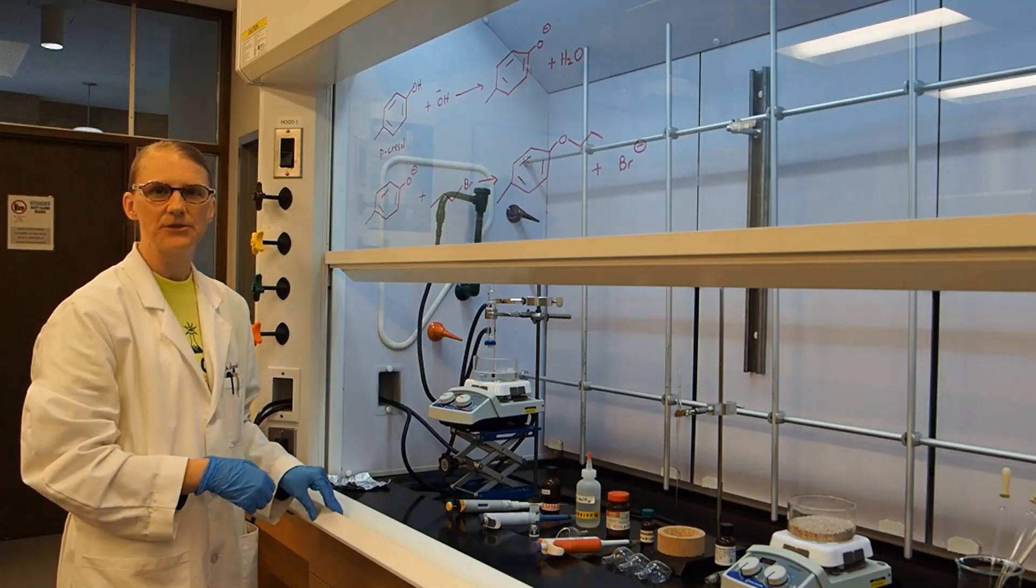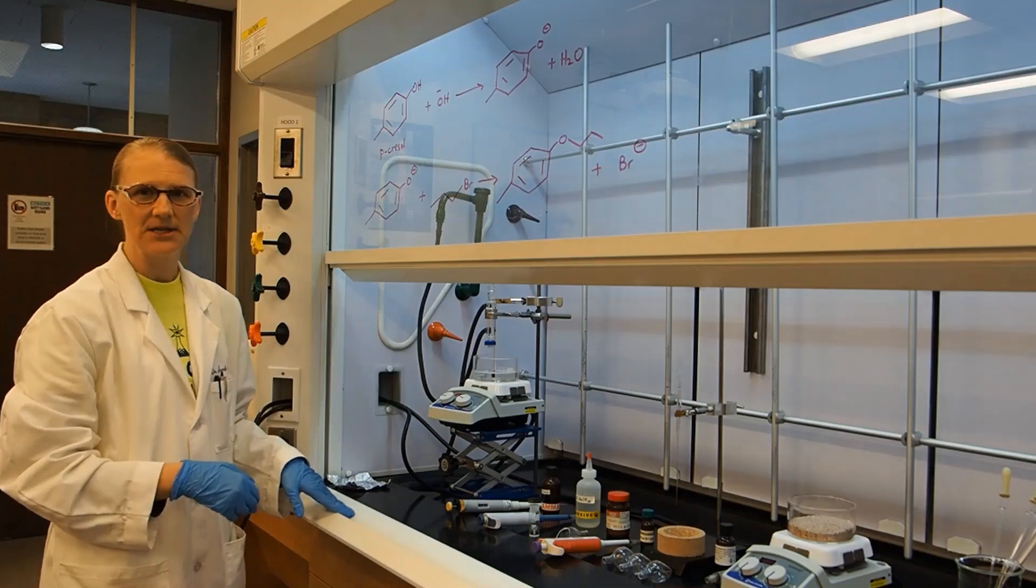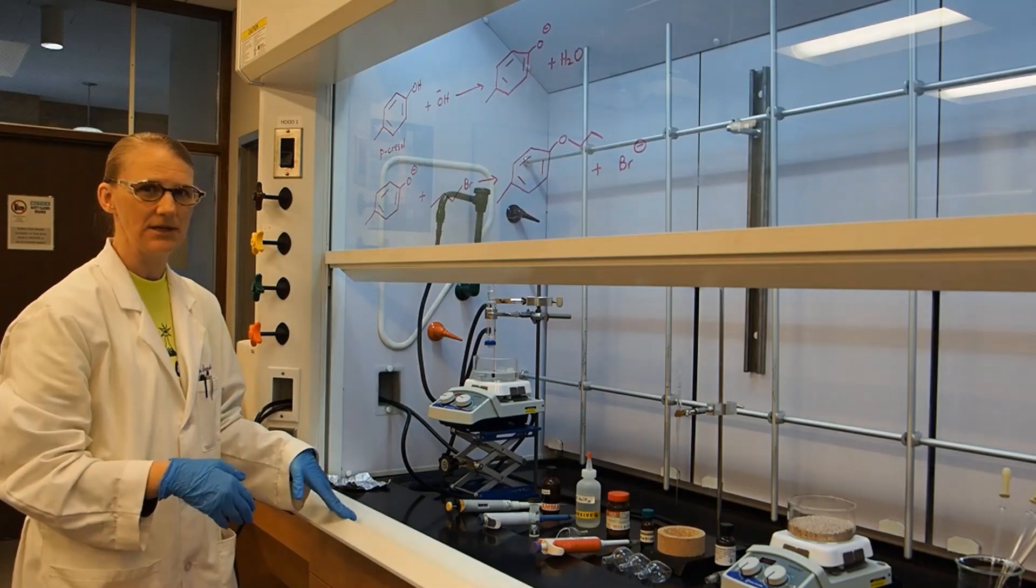Today we're going to be doing the Williamson Ether Synthesis. I've set up some things in advance so you don't have to watch me set those up.